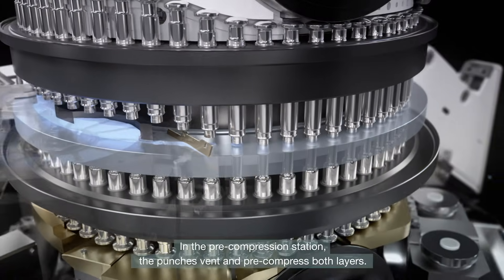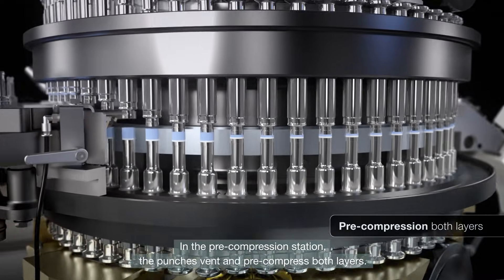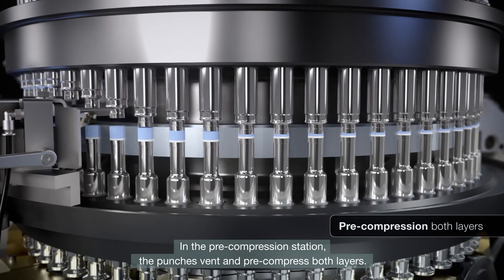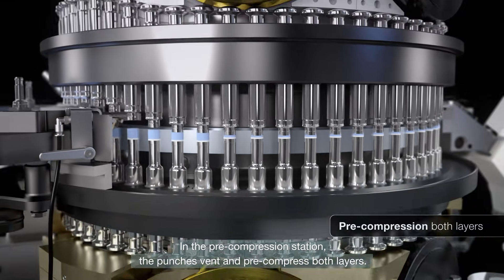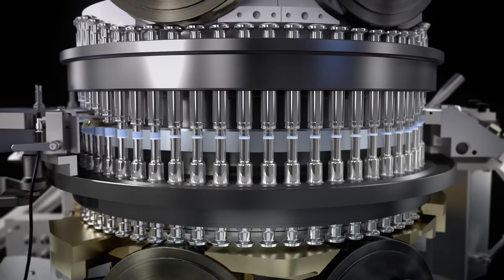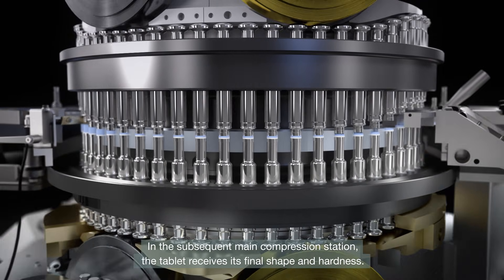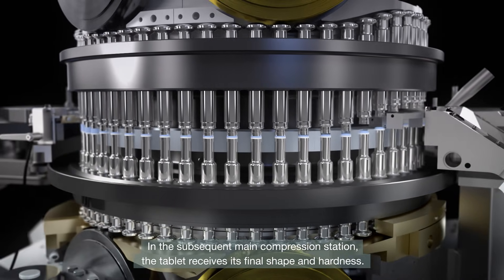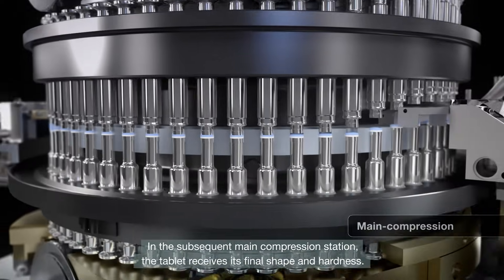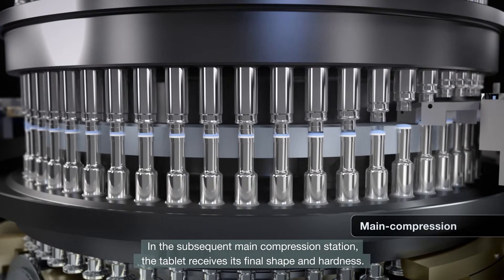In the pre-compression station, the punches vent and pre-compress both layers. Then, in the subsequent main compression station, the tablet receives its final shape and hardness.